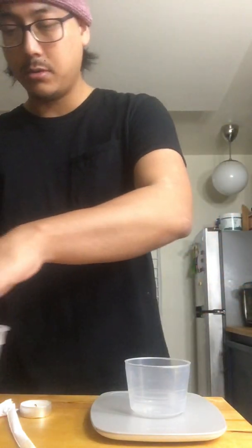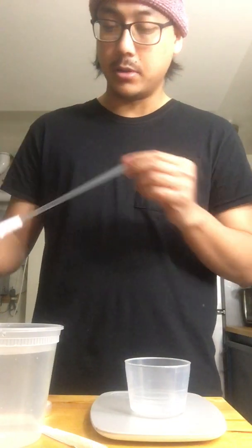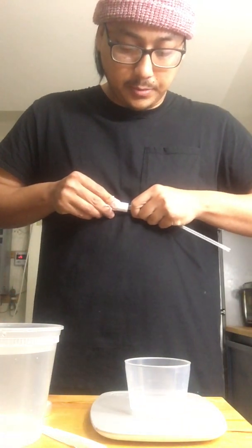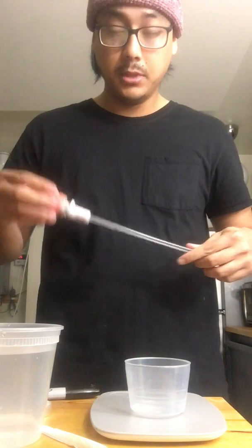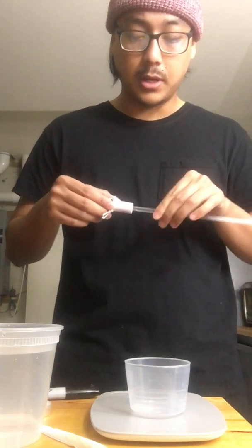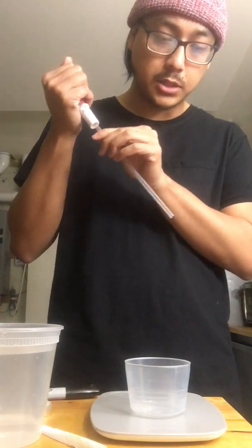So now, because there are no graduations on this and we don't know how much volume this is gonna dispense, we're gonna mark it off with a sharpie. Also, if you're having trouble with your measurements, make sure the seal between the straw and the pipette is sealed, because a vacuum needs to be created in order for suction to happen.